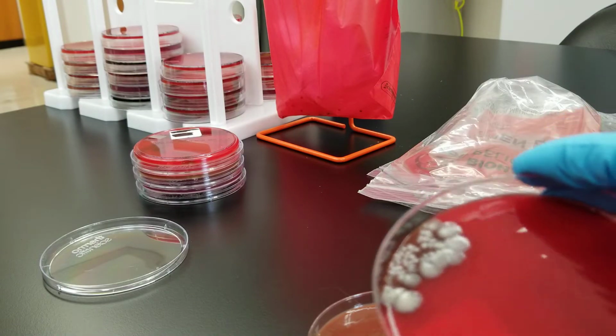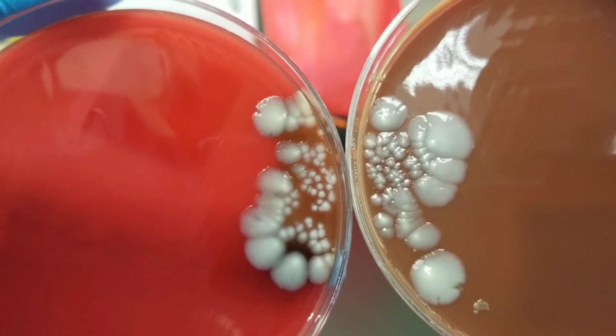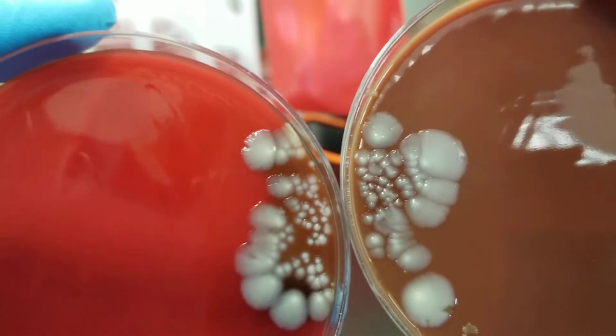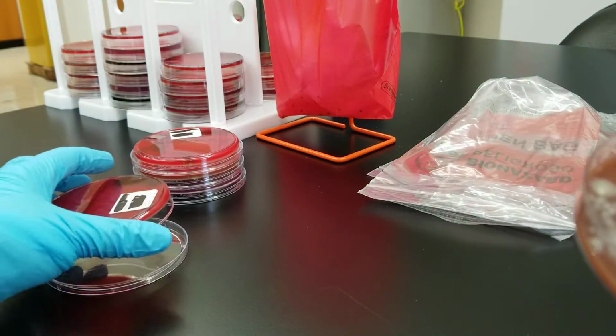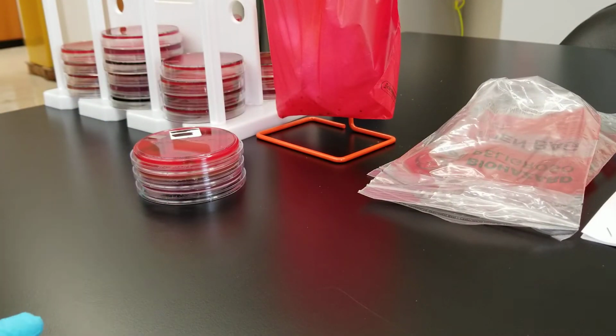All right, so what do you think? If this is a peritoneal fluid and we got growth like this, a GNR growing in a peritoneal fluid, is that a pathogen or is that fine? The answer is this is a pathogen. This is Klebsiella, and that should not be a part of a peritoneal fluid. There really isn't any normal flora in a peritoneal fluid. So there could be a tear or something in the gastrointestinal tract, and that's how Klebsiella got in there.